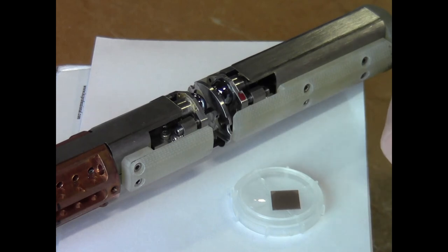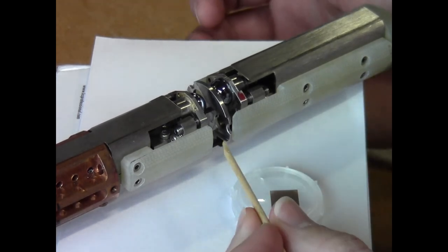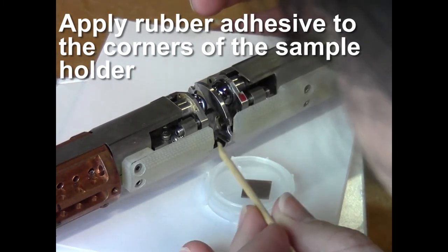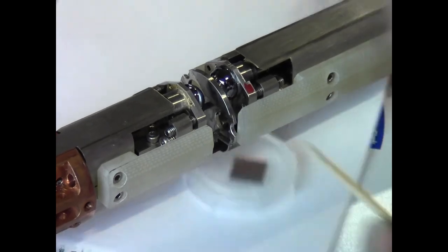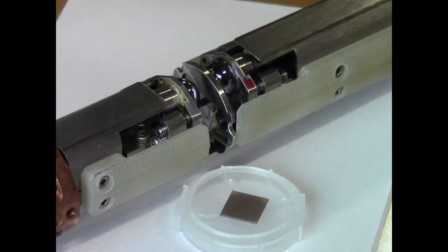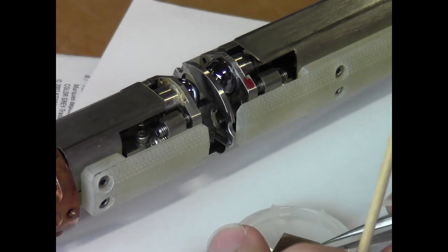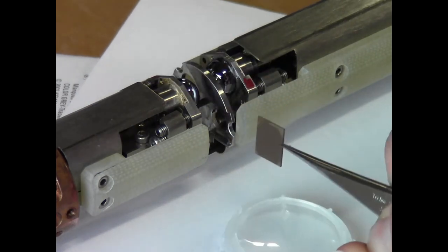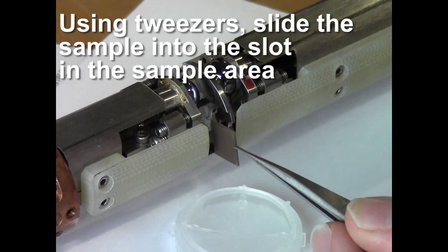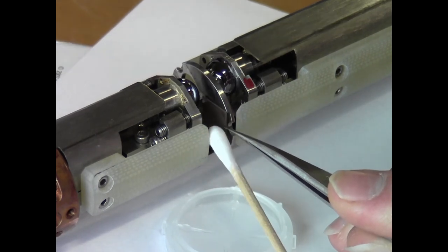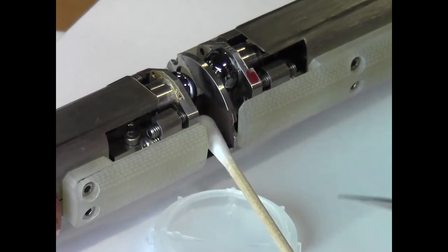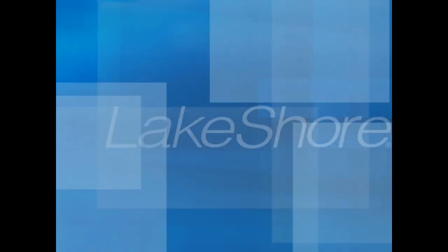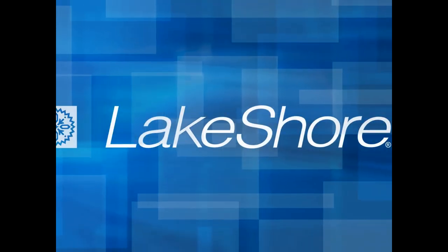We'll start with a little bit of rubber adhesive on the end of a Q-tip. We want to mount a little bit of adhesive in the corners of the sample holder. We will grab the sample with a pair of tweezers. There is a slot for the sample to slide into. Use a Q-tip to press down on the top of the sample and our sample is mounted.